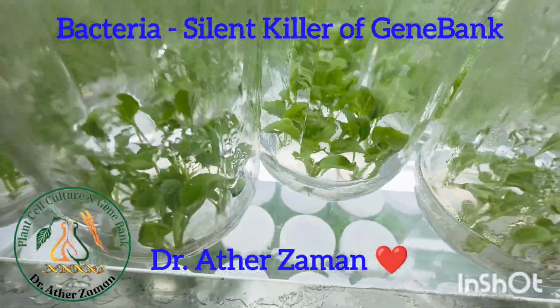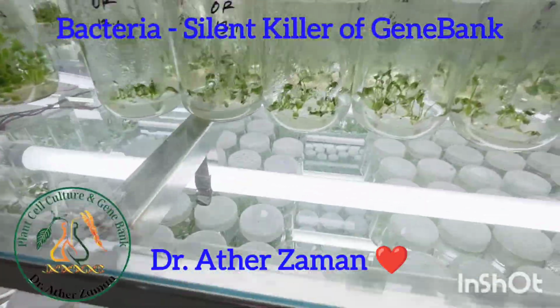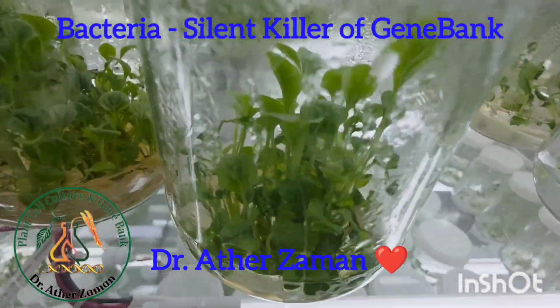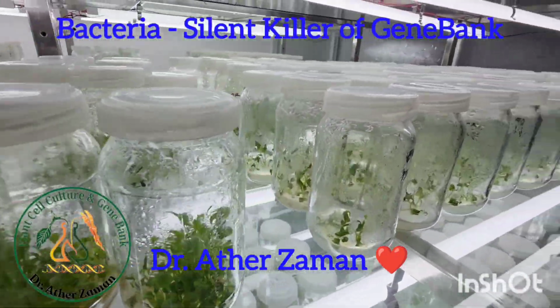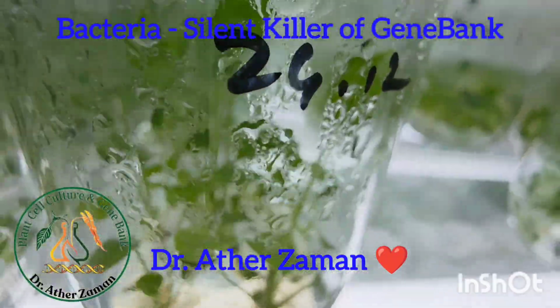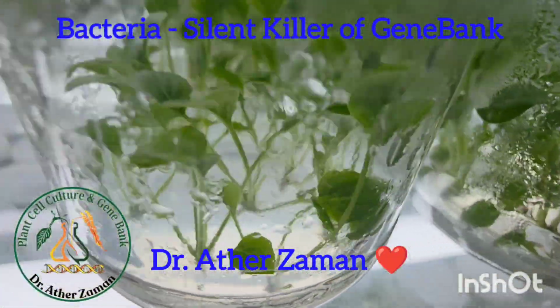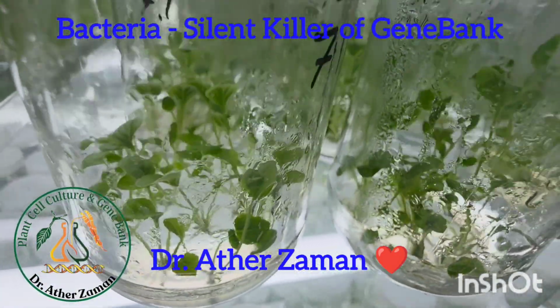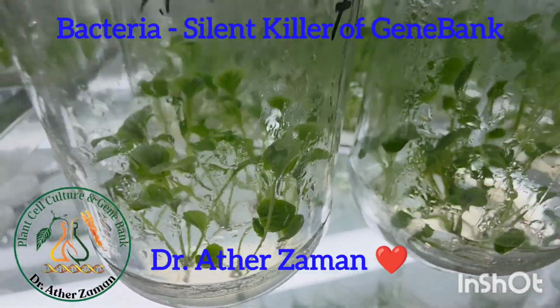Whatever you have seen, this is pure plant, no contamination whatsoever of any bacteria or fungi. It's a very clean gene bank we have developed so far. But today I will show you the bacterial contamination. It is very difficult to get rid of any bacteria, either endogenous or even superficial, in the media or in any part of the plants or even the forceps.